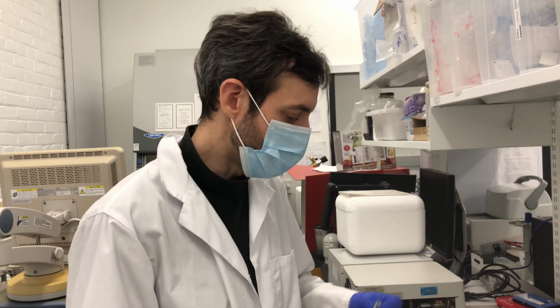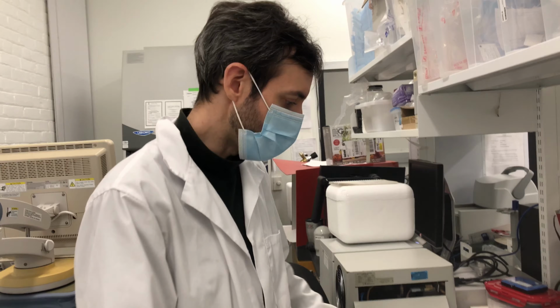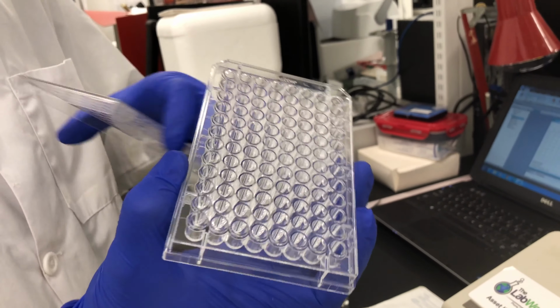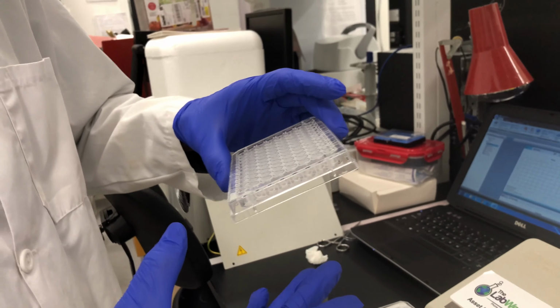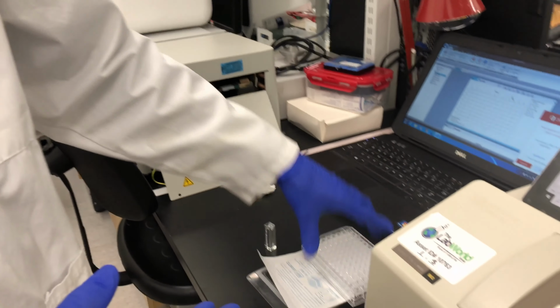is just to get some reproducible data, and we'll look at, say, the cuvette and the 96 well plate shown here. So this is just clear bottom, flat, round well. And depending on which one you use, you're going to have some different errors associated with it. So we'll start with the cuvette.